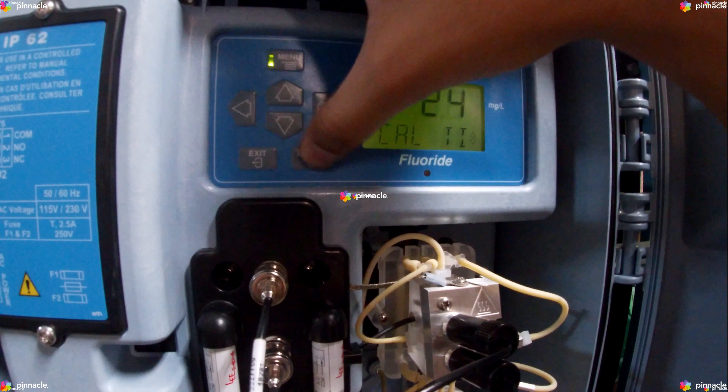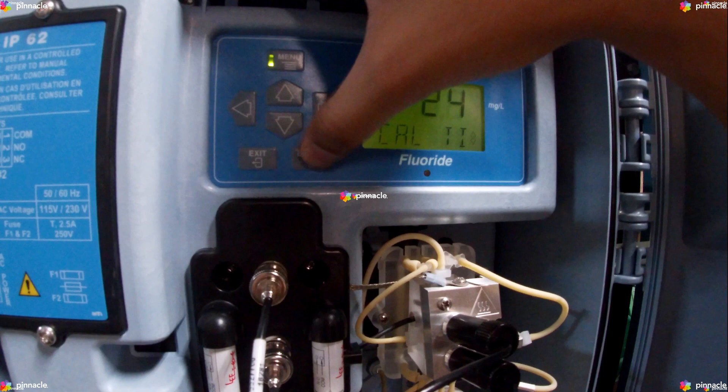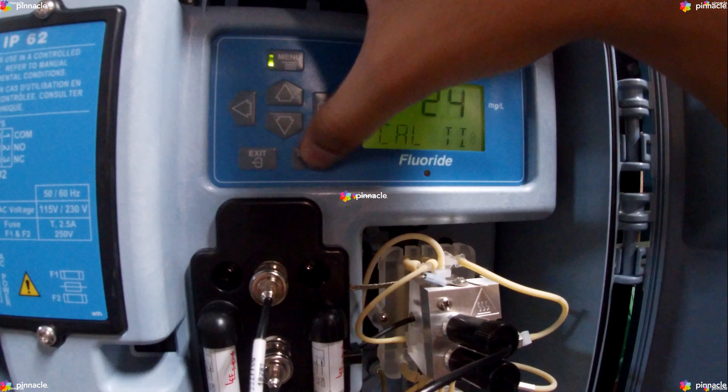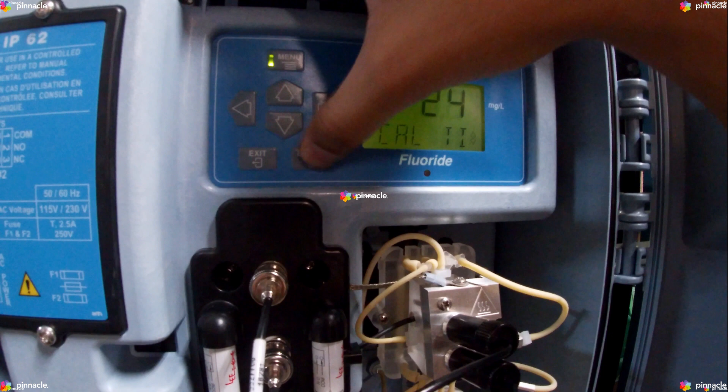The Slope option shows the current slope value. Typical values are between negative 53 to negative 63 millivolts per decade. New electrodes might have a slope that is negative 40 to negative 50 millivolts per decade. As the electrode's conditions stabilize, the slope value calculated during calibration rises.